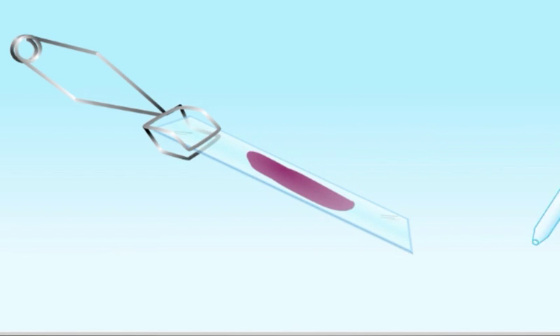The cells are then decolorized by washing with ethanol or acetone. This is the differential step. Gram-positive bacteria retain the crystal violet, whereas Gram-negative bacteria do not. The ethanol or acetone should be added drop-wise, with the slide tilted at an angle until the drop coming off the edge of the slide just starts to become colorless.